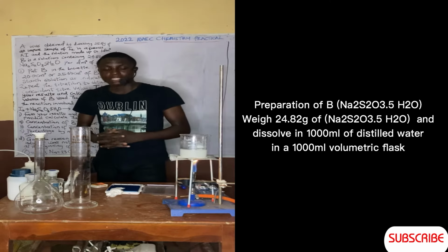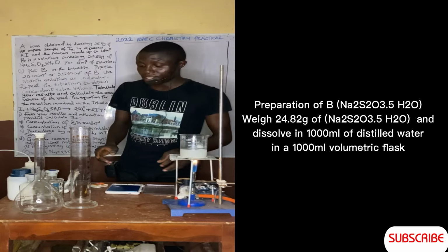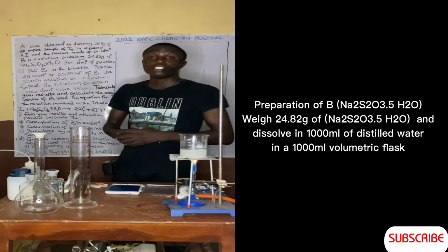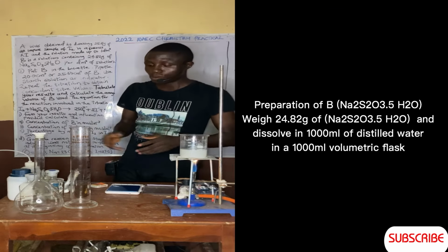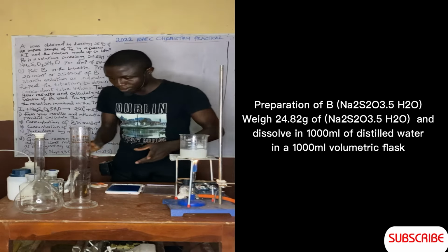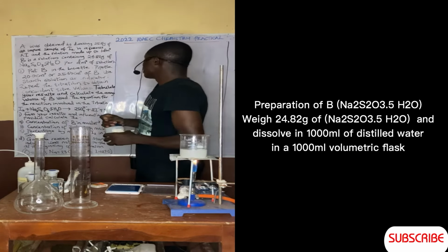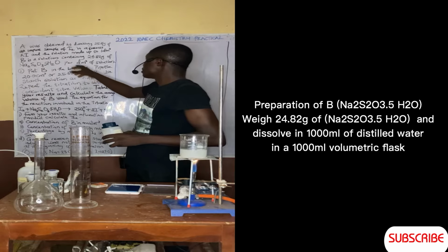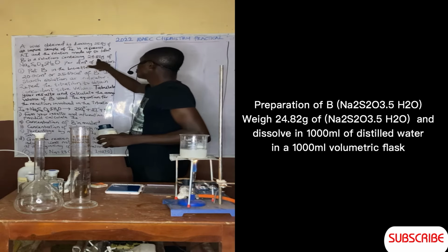I'm going to measure the sodium thiosulfate, and I'm going to dissolve it in 1000 cm cube of distilled water. So where is my salt? This is my salt here. Then I'll weigh it now, which is 24.82 grams.